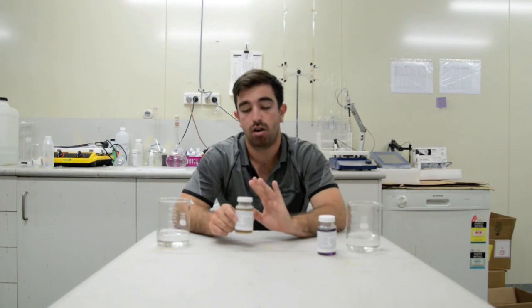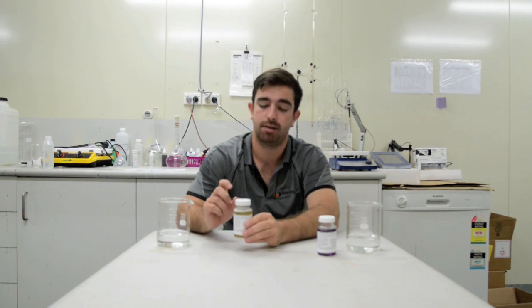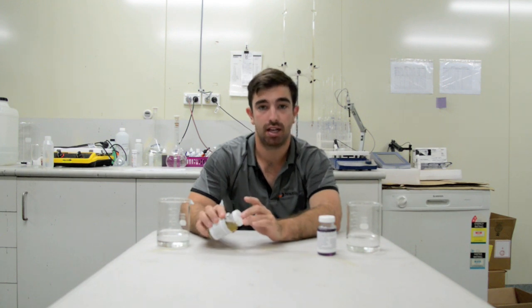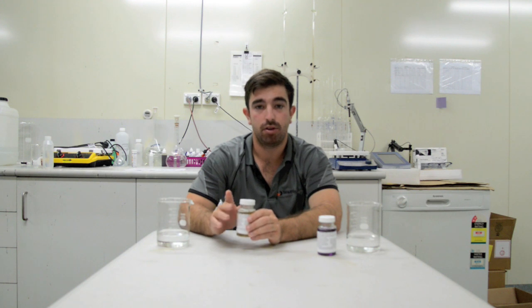This one, on the other hand — remove the lid. It's going to smell, so be very careful. Get some bleach and pour a little bit in. Put the cap back on, shake, and leave for 20 minutes. Then remove the cap and pour down the toilet carefully. Flush away. Do not put the lid back on the bottle, and dispose of the jar in the bin.